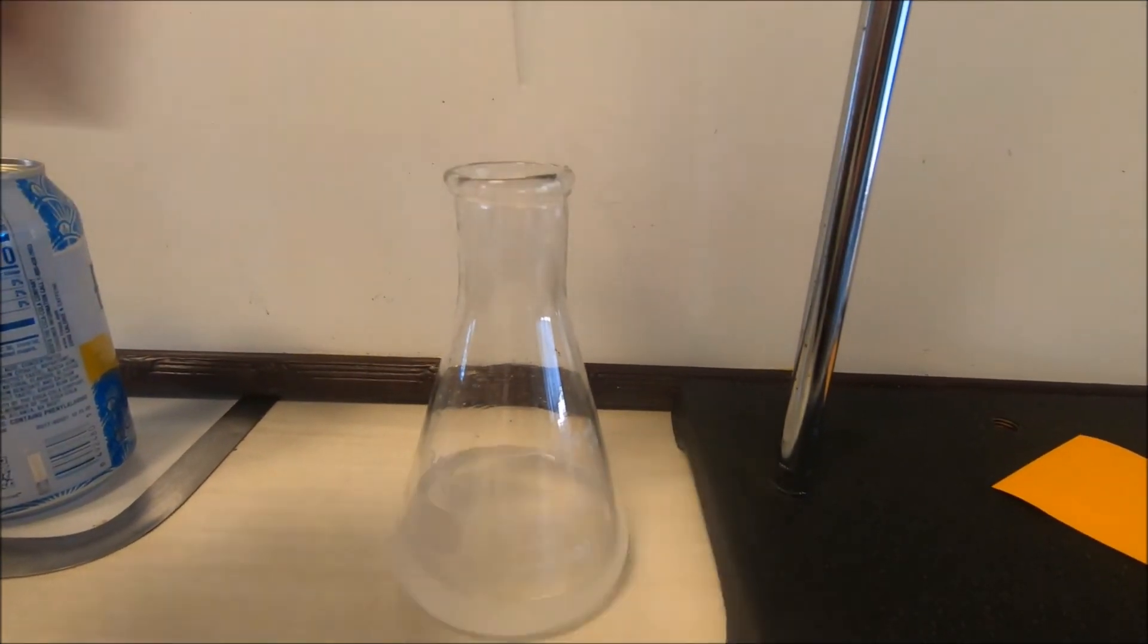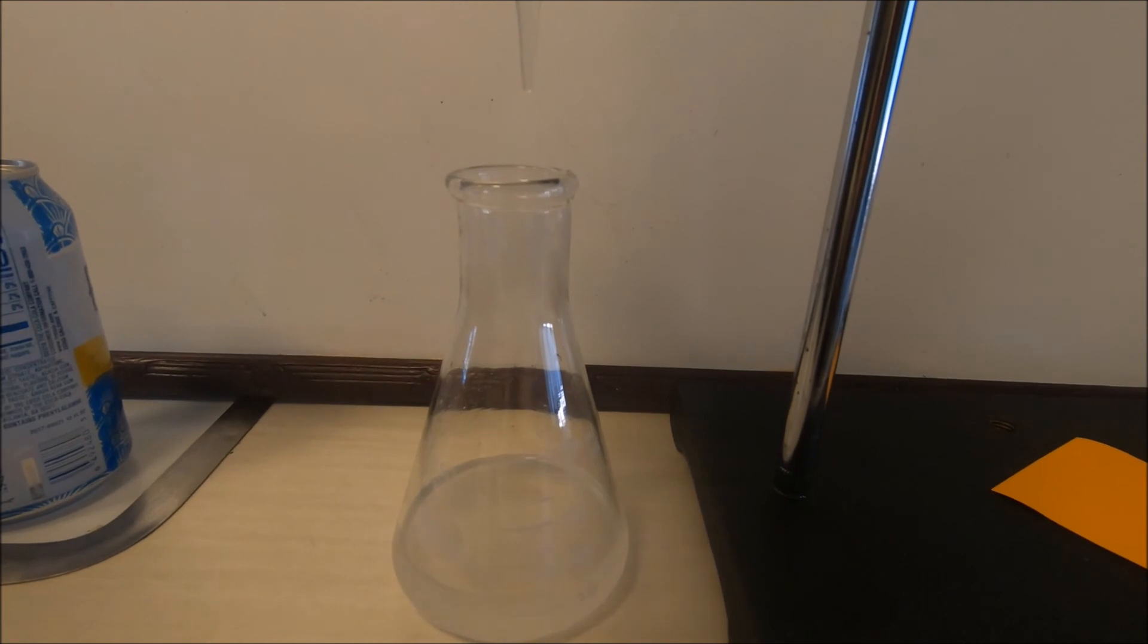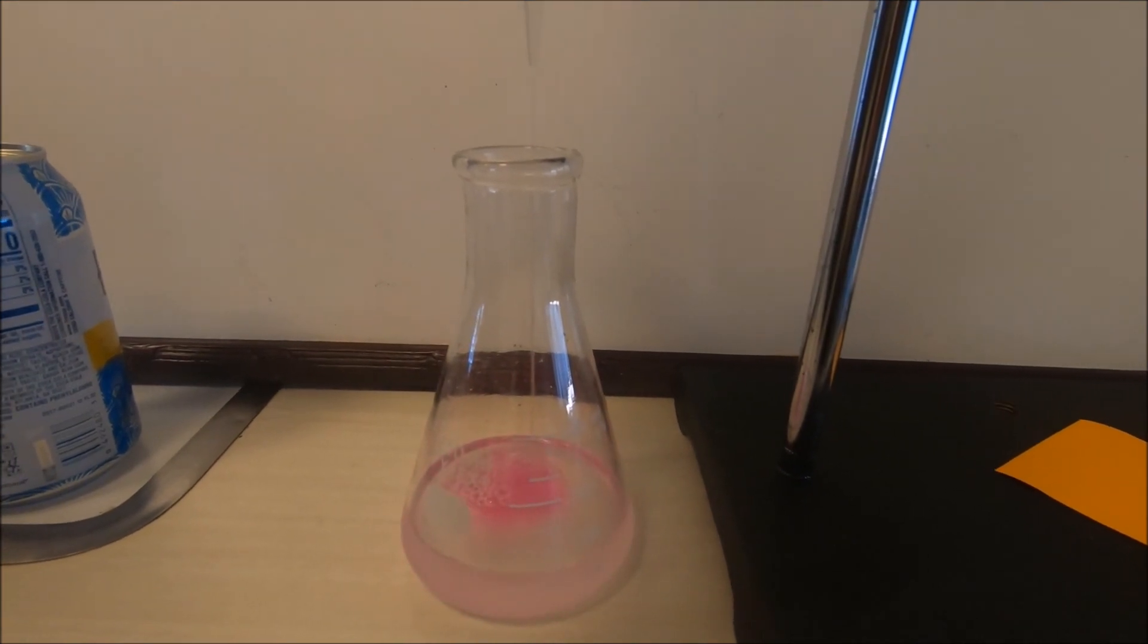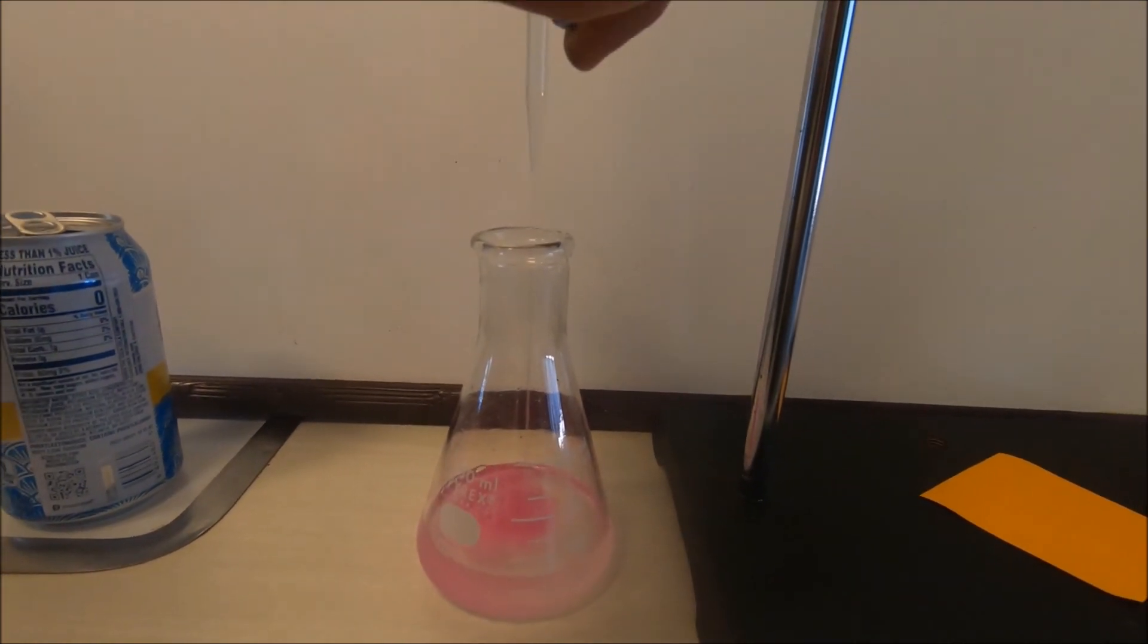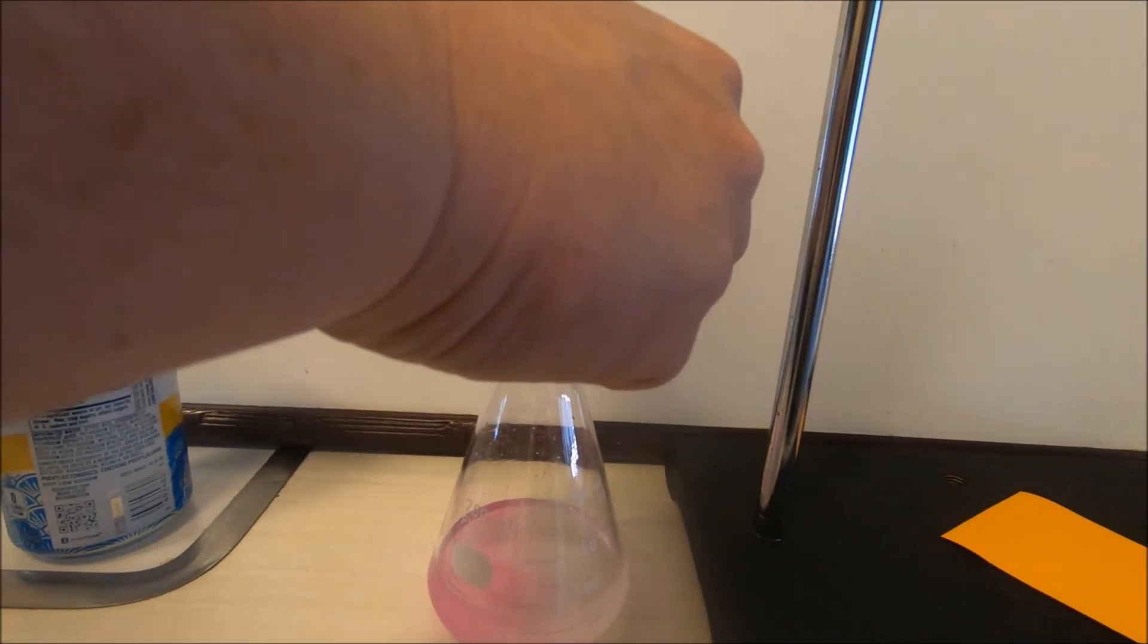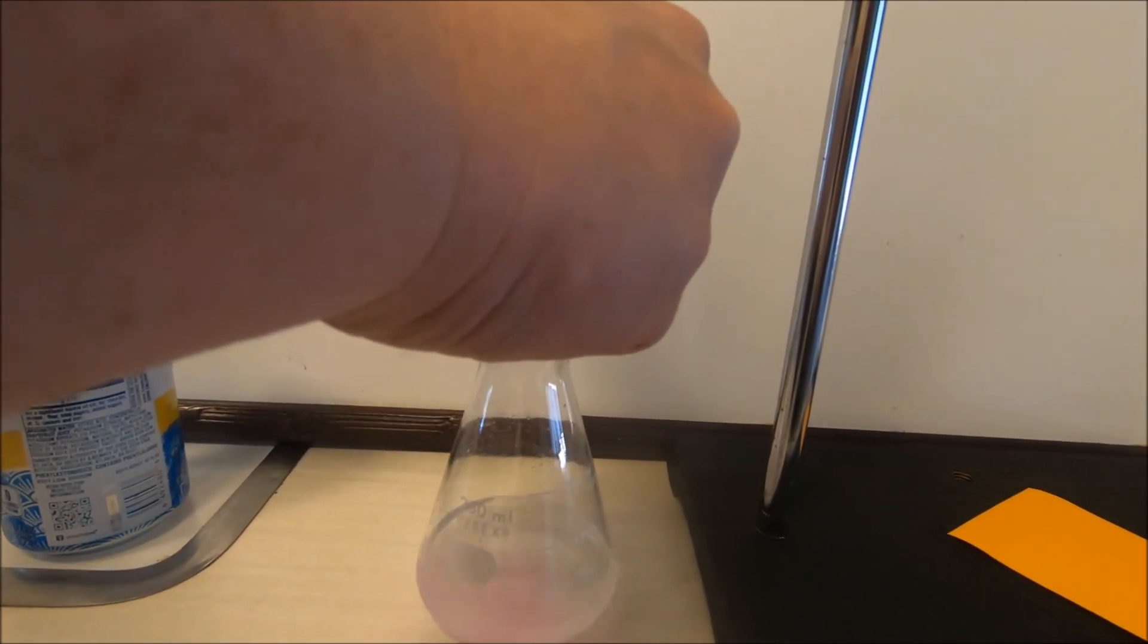So that indicator then goes back to being clear. As we add base, notice that pink is staying around longer before being neutralized.